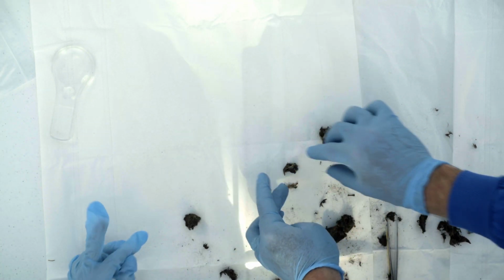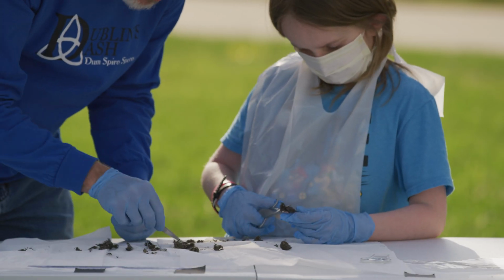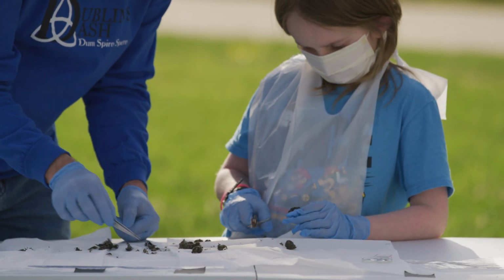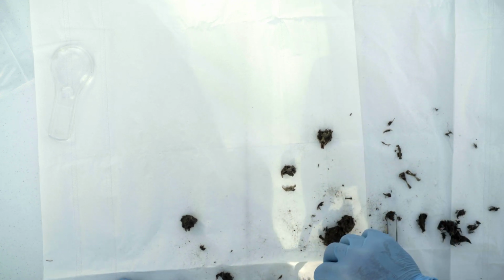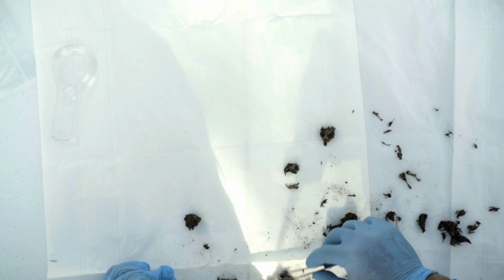We got some more pieces. Yep, there's his other. So there's the full skull piece right there. There's a leg bone. There's some ribs. There's another leg bone. There's some more ribs. Lots of little bones in there. I felt something hard in this piece right here.